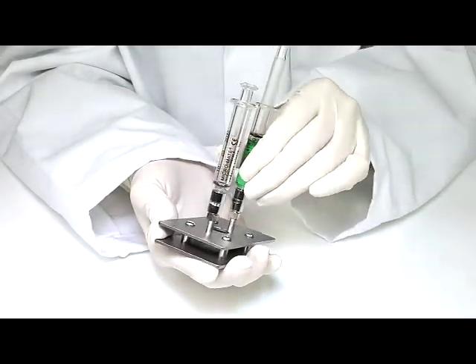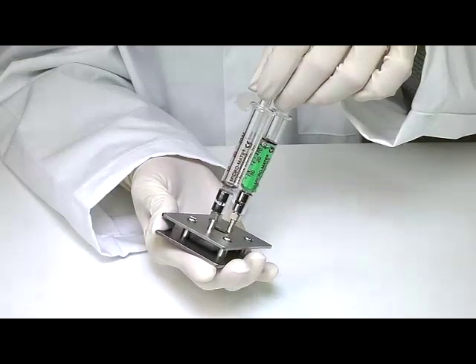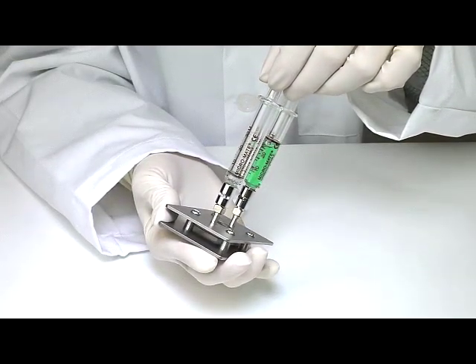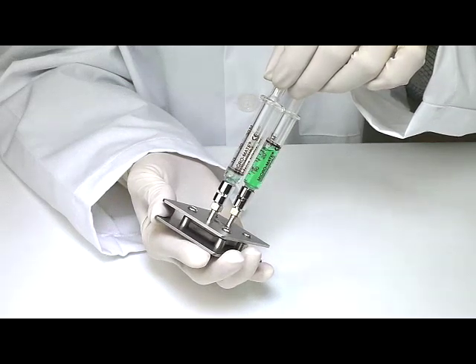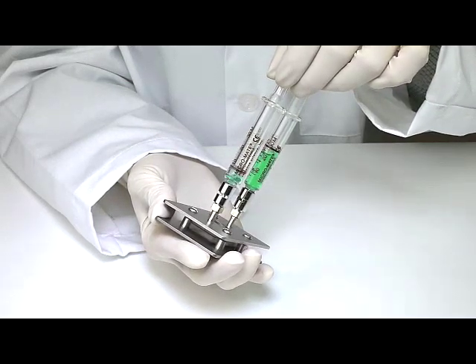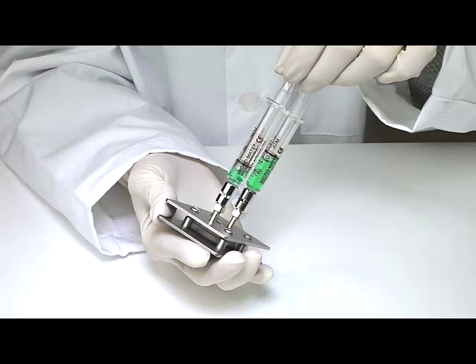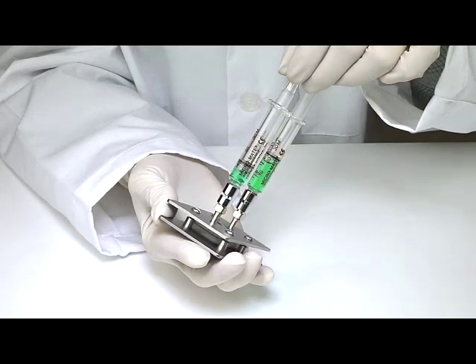Holding at about a 45-degree angle, pull out on the plunger of the empty syringe. This creates a pressure differential, which in turn causes the liquid to fill the cell and eventually fill the syringe. For more viscous samples, when you pull out on the empty syringe, pause and allow time for the fluid to flow.